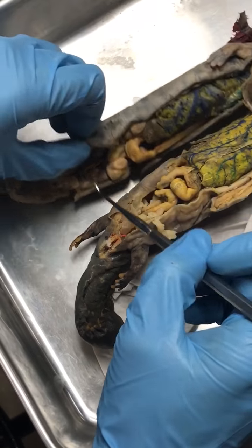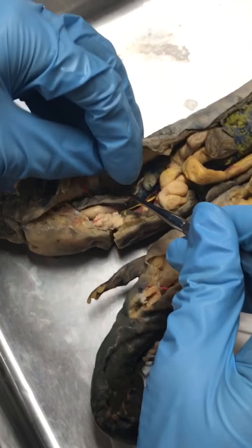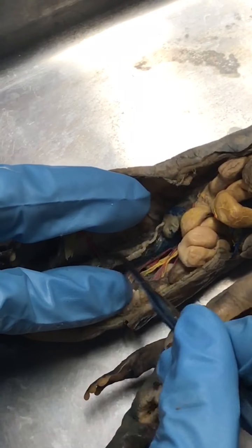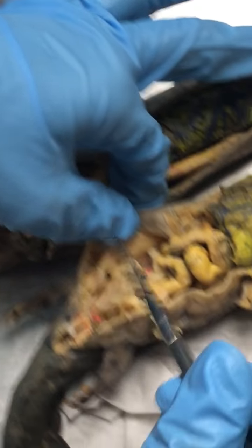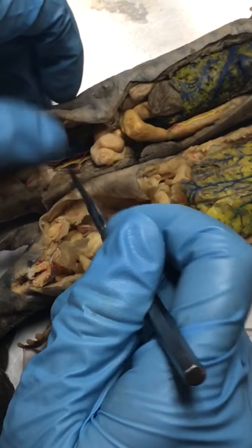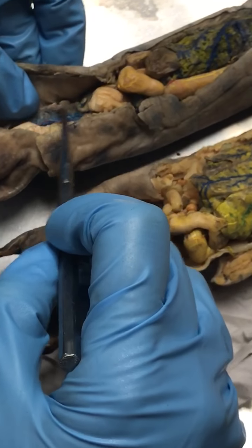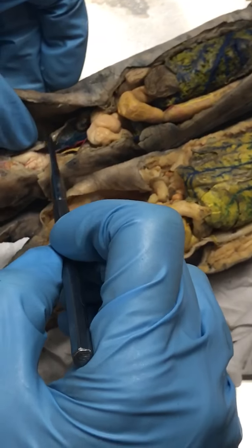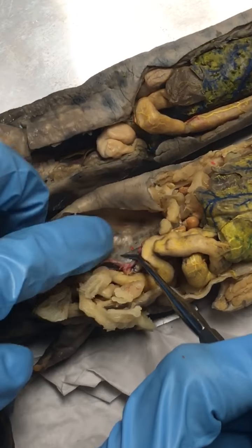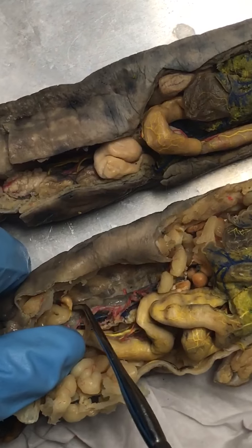They both have kidneys. Easier to see from behind. So the gray, smooth area. And there's two, but I'm just going to show you one. You can see it from the front, it's okay, just easier to see from the dorsal side. Same with the female. Kidney looks the same.